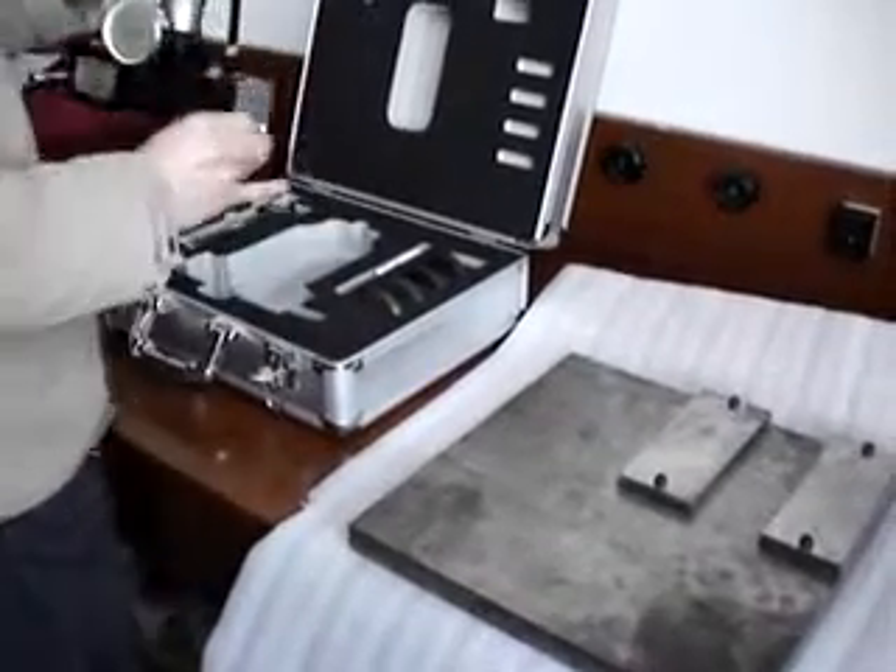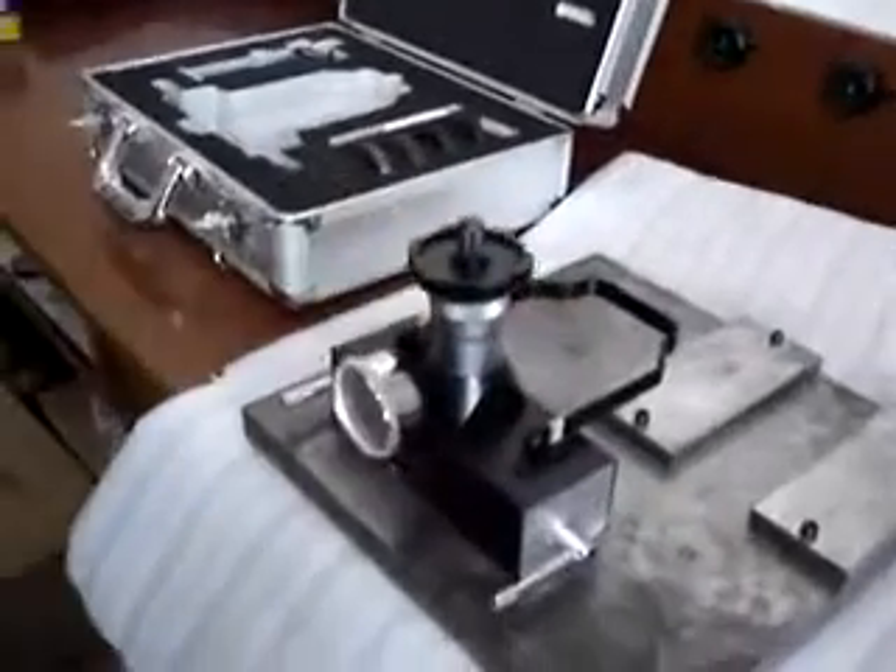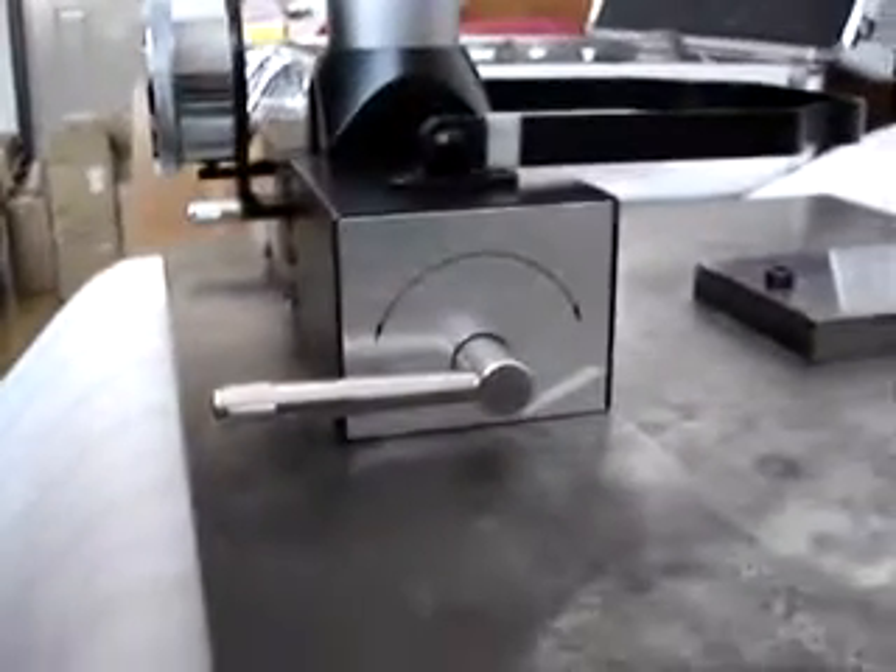Before the test, check the magnetic switch and ensure it is set at release. If not, place the magnetic switch at release immediately.